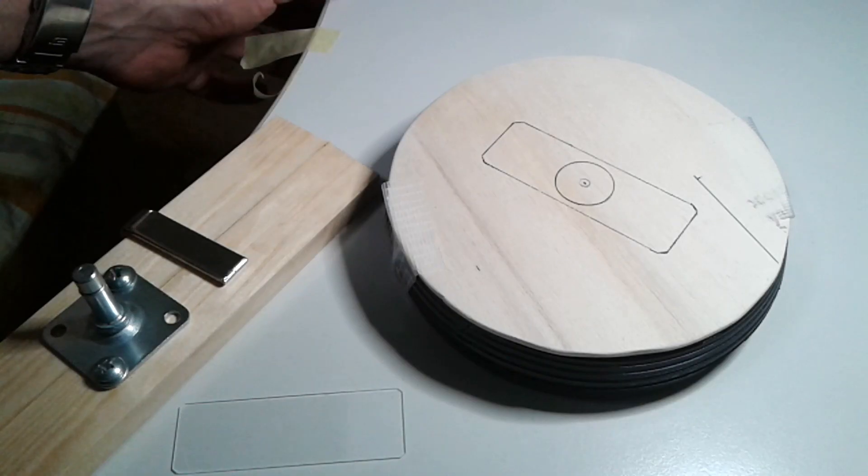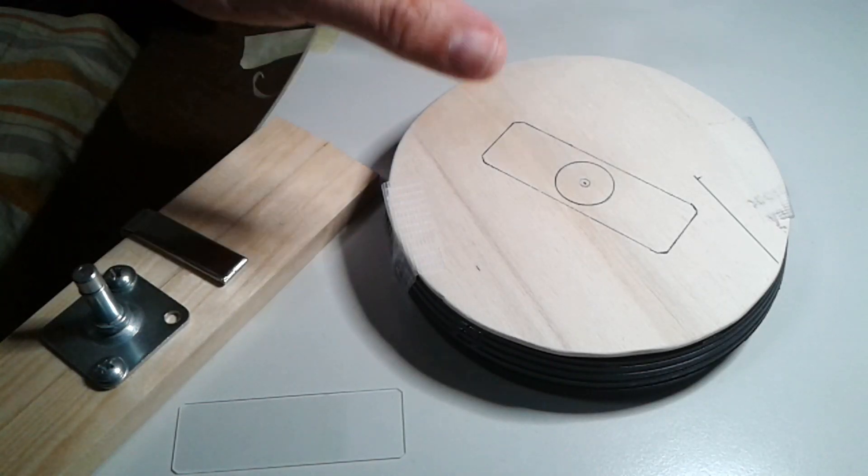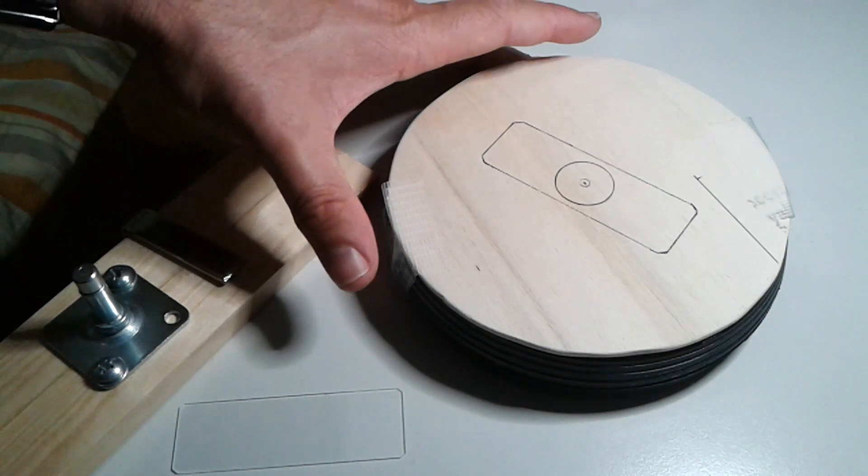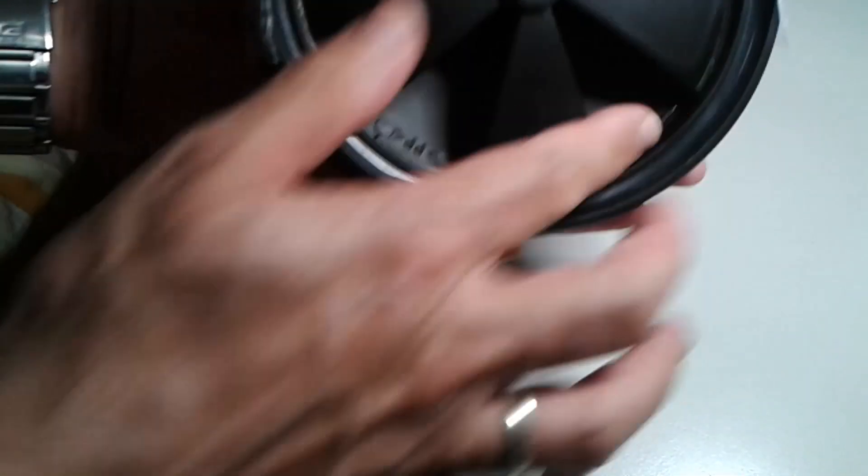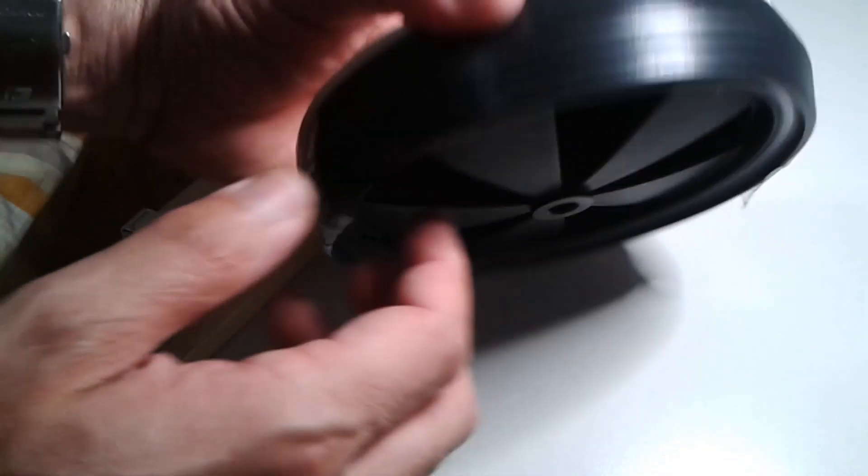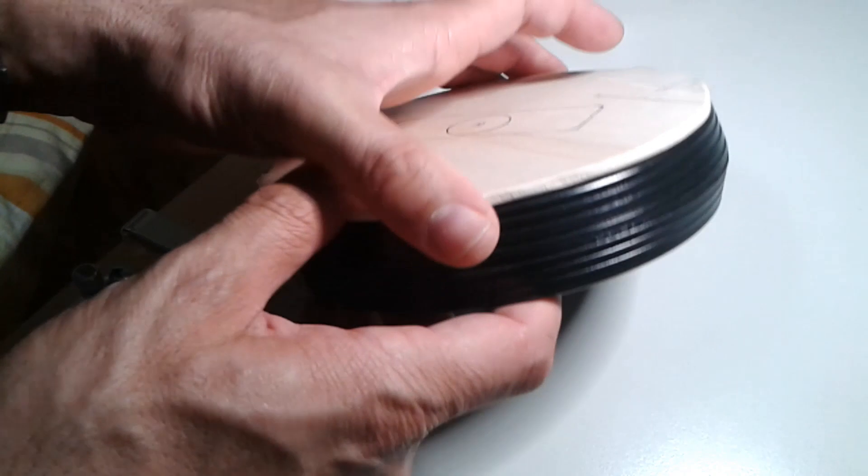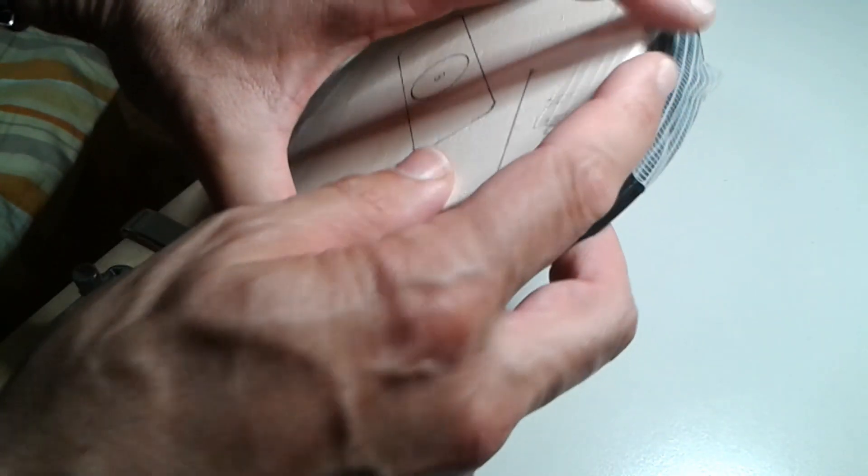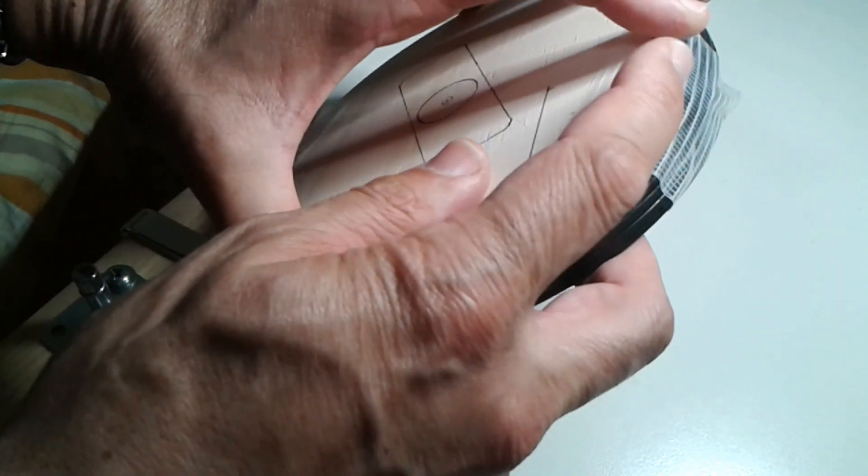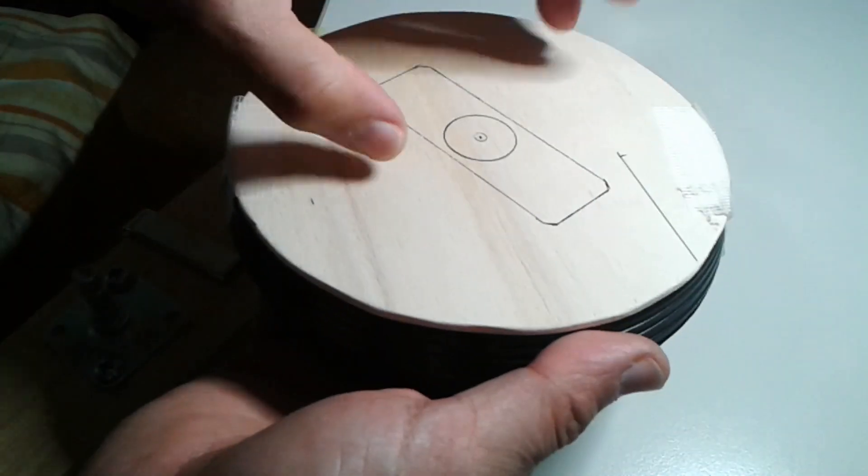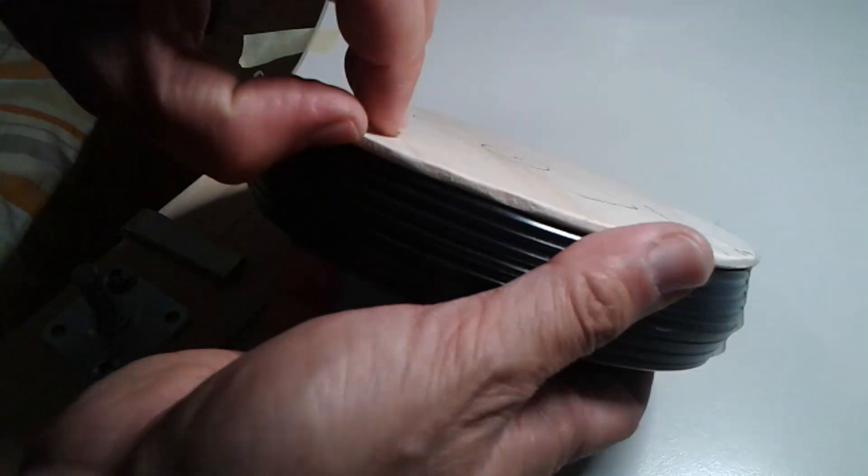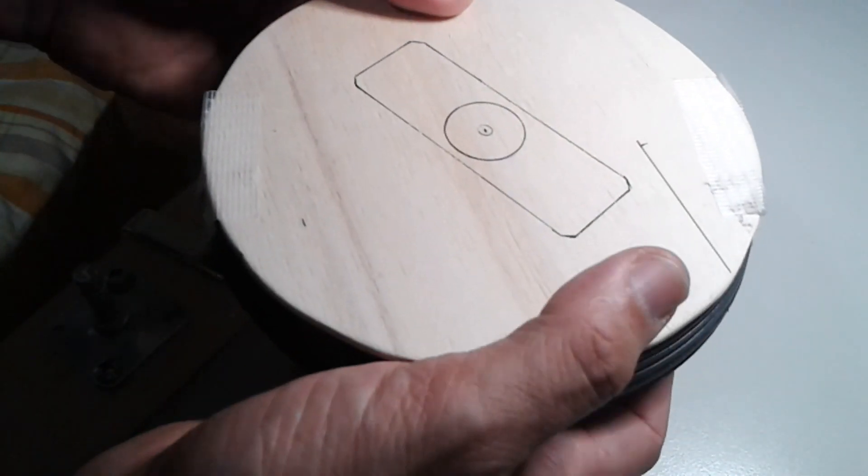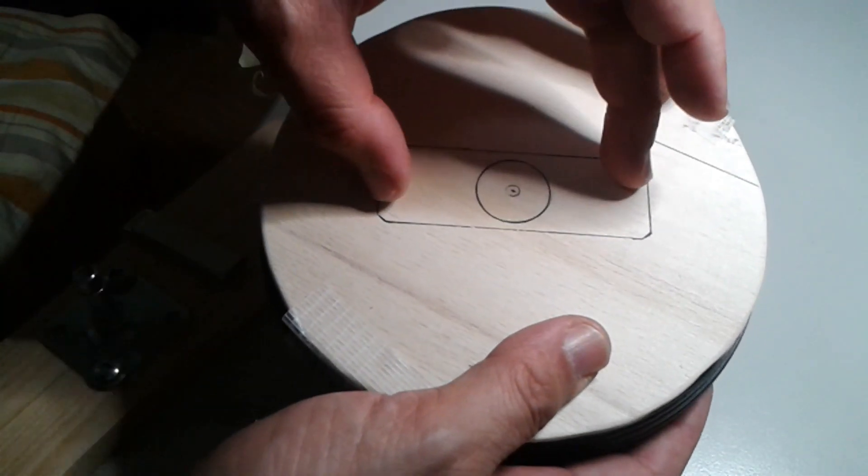Let's get started. This is my slide ringing table. I've got a plastic wheel that I got from a hardware shop. I taped a thin piece of plywood on the top. This is the place where I'm going to place the slide.